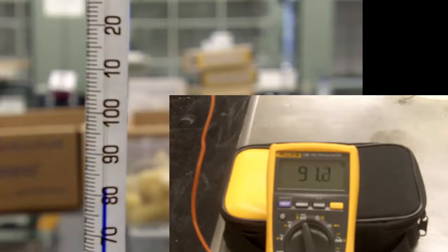When the thermometer is reading 80 degrees we're just slightly over 90-91 degrees on the digital thermometer, holding at about a 10 degree difference. When the thermometer is about to hit 100 degrees, the thermocouple is reading about 108-109 - still significant lag. What I always encourage students to do is once their material is fully melted, turn off the meltemp. Let's go ahead and turn it off now.